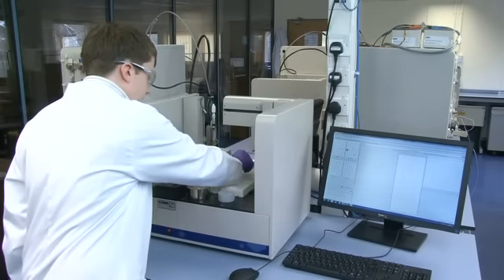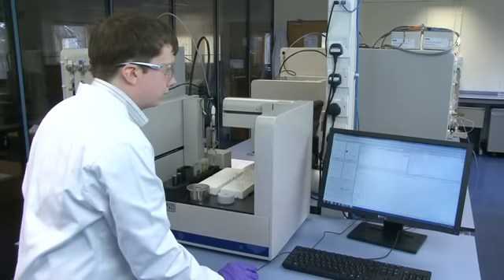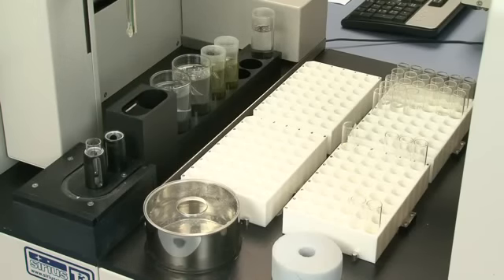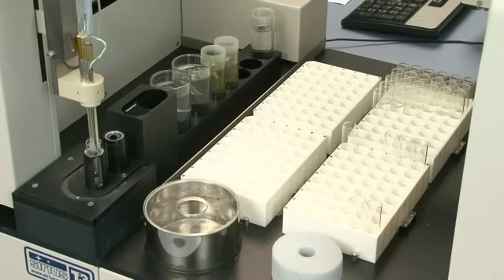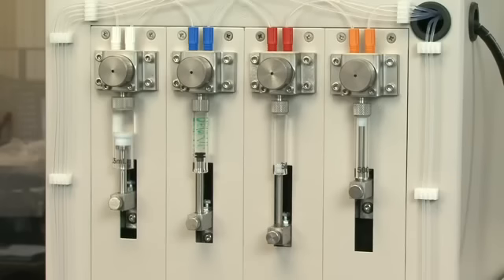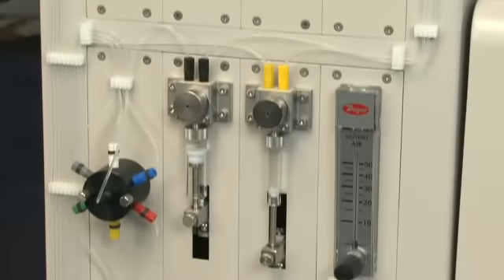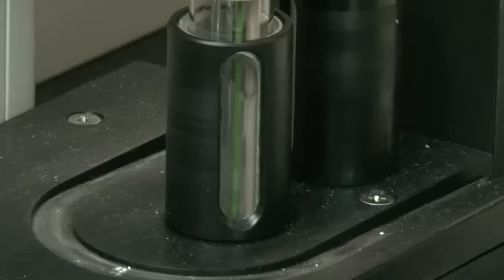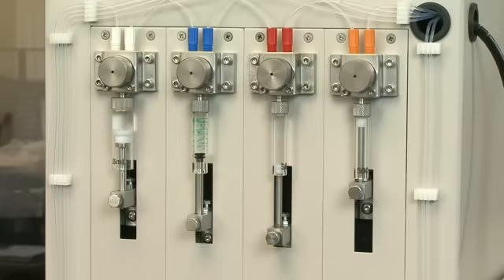In this second experiment, log P is being determined. The analytical unit is positioned in the sample tube. Known volumes of water from the white dispenser and octan-1-ol from the yellow dispenser are added. The mixture is stirred and acid from the red dispenser is added slowly.